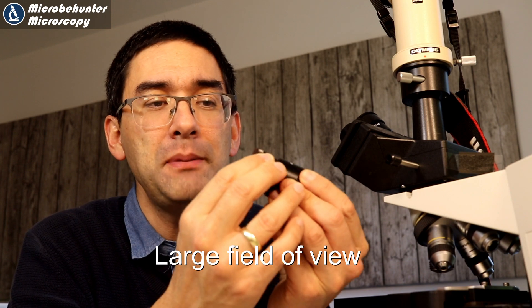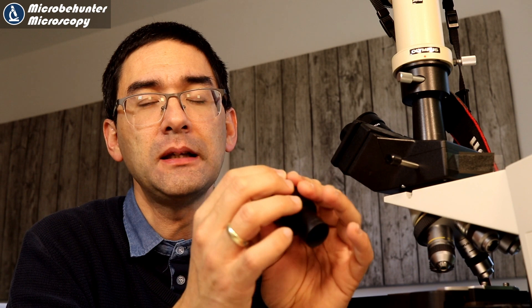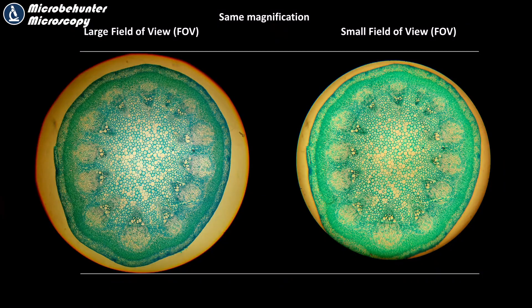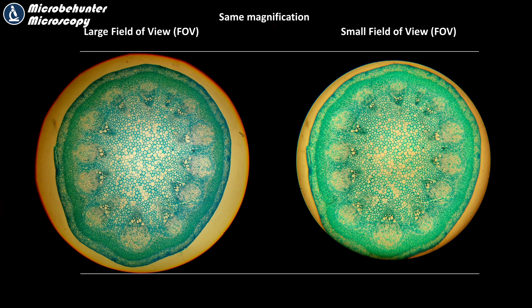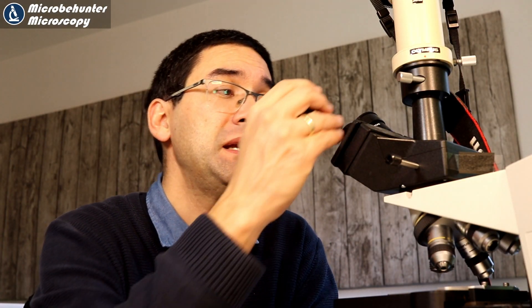So two points are already covered: large eye relief, and large and heavy microscope for convenience. The third thing I'd look for is eyepieces with a large field of view — wide-field eyepieces. This means when you look through them, it does not look like you're looking through a tunnel; you can actually see a larger part of the specimen. This is simply much more convenient and comfortable, especially when you spend many hours behind the microscope.